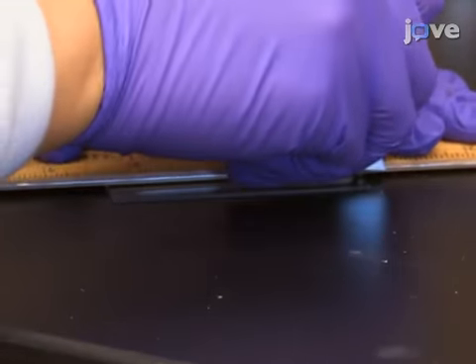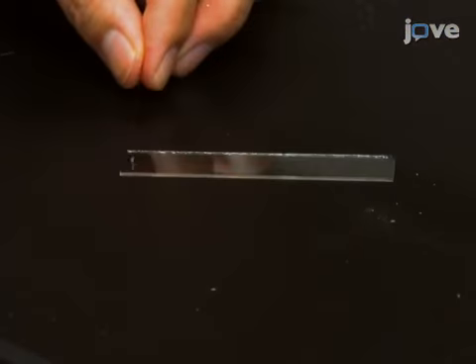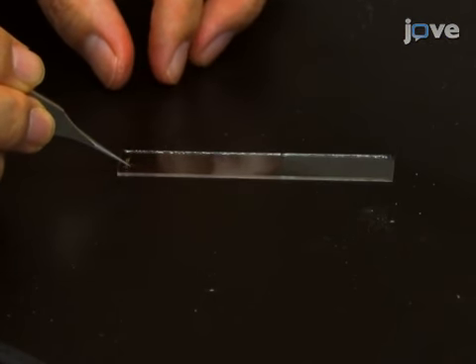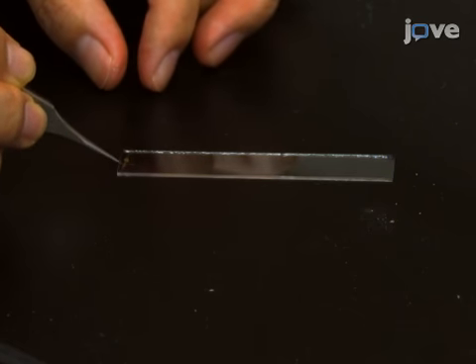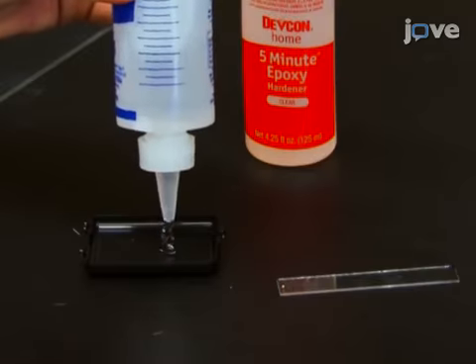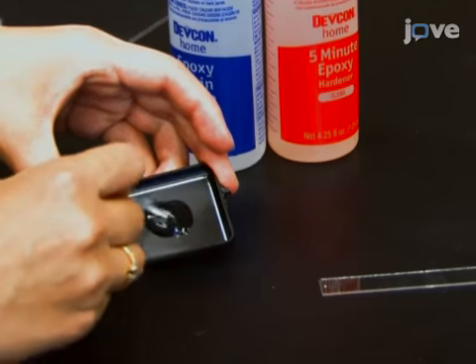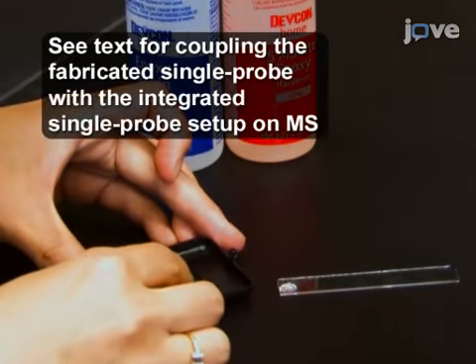Next, cut a standard microscope glass slide in half lengthways. Then, place a single probe onto one end of the glass slide so that the nano-ESI emitter is pointed outwards. Apply the regular epoxy to the body of the single probe so that it becomes secured onto the glass slide before leaving overnight for hardening.